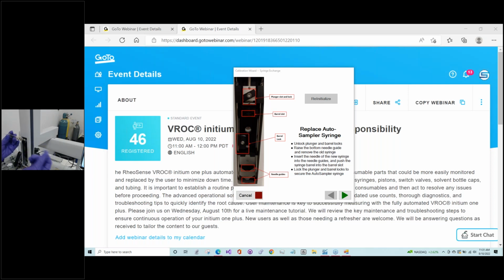You don't want it too loose, because if it is too loose, you won't draw as much sample as you need and you won't load as much. And this is critical if you have lower sample volumes that you're running. So I'm just going to pull it out. I'm not going to pull it out all the way, just enough, and then I'm going to slide it through.